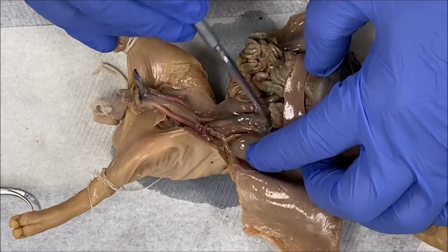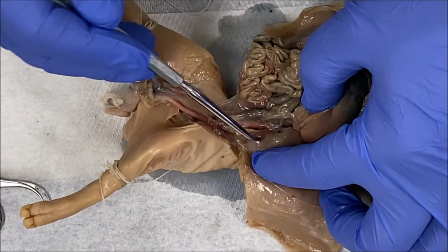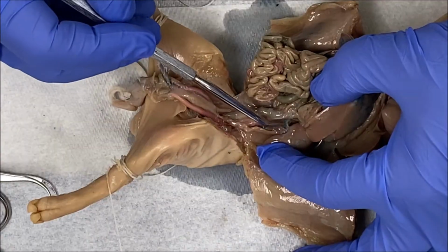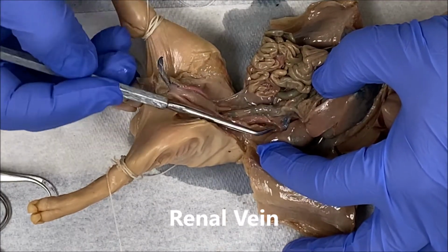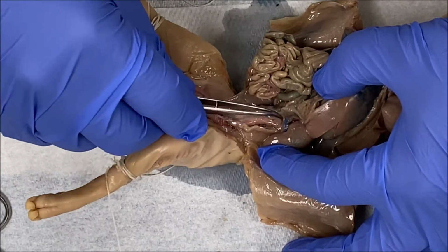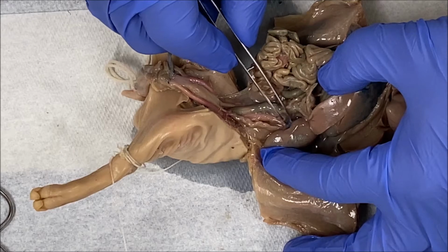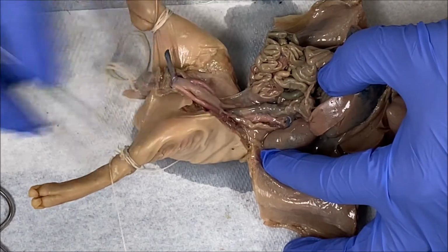Let's see if we can identify any blood vessels entering and exiting the kidney. This blue blood vessel that you can see here, entering or exiting the kidney, is the renal vein. And right next to the renal vein, you have a red blood vessel right here. This is called the renal artery. So you have the renal vein, which is blue, and the renal artery, which is red.